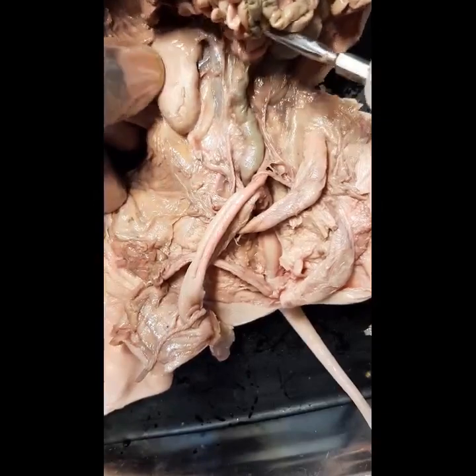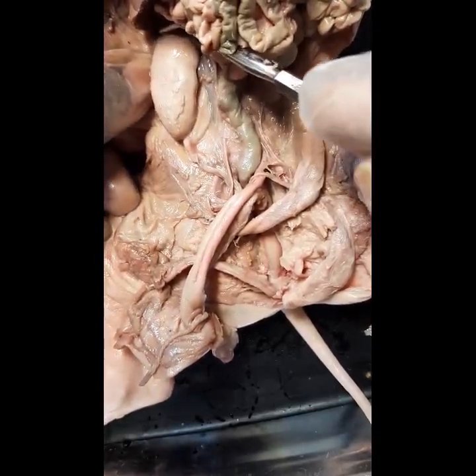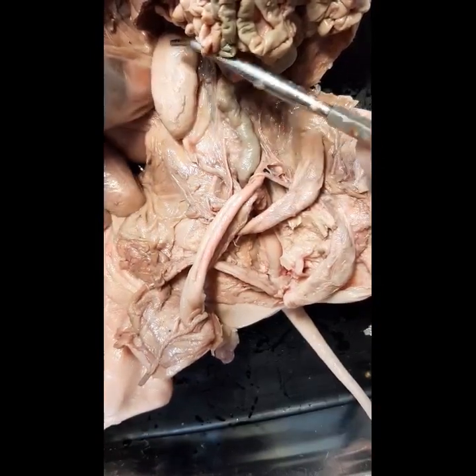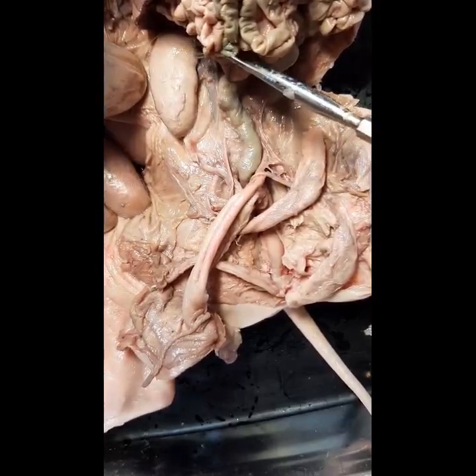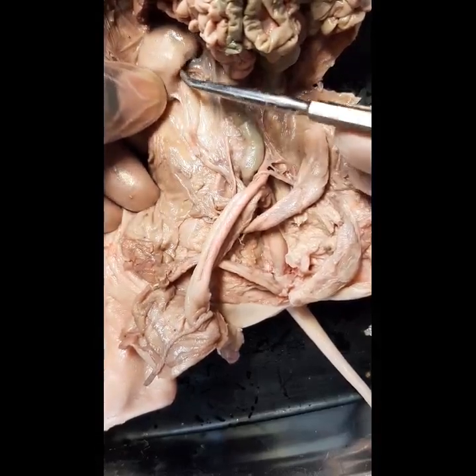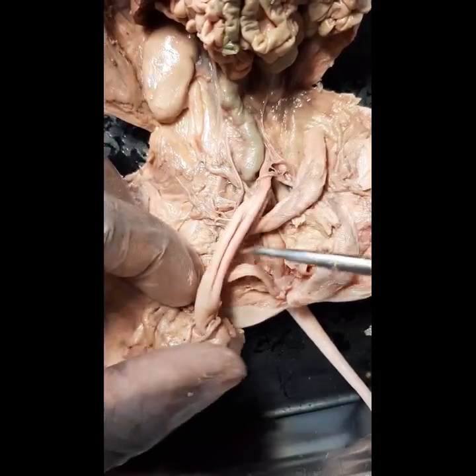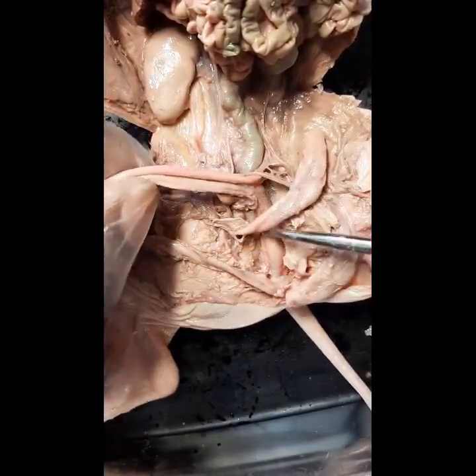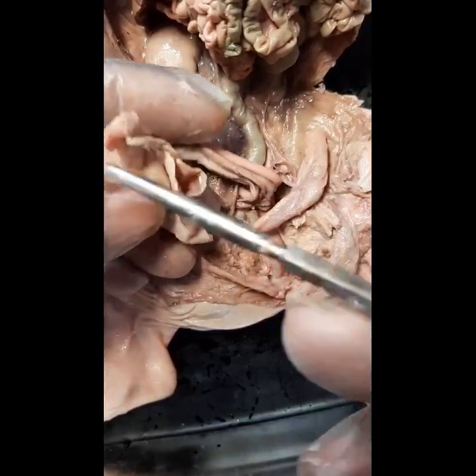Like the female, we have the renal cortex and the renal medulla. Urine would flow into the renal pyramid, into the minor calyxes, into the major calyxes, and then into the renal pelvis. It then flows through the ureter into the bladder. When it's time to void urine, urine would go through the urethra, out through the penis, and out through the urogenital opening.